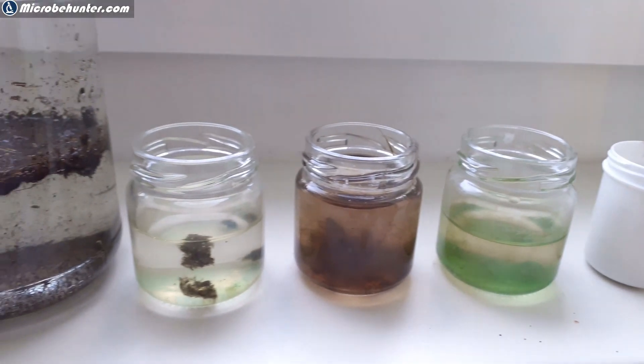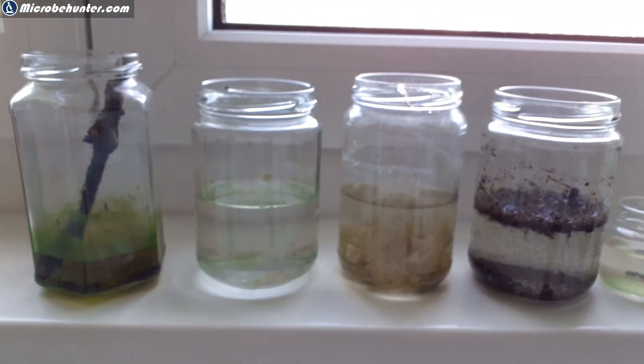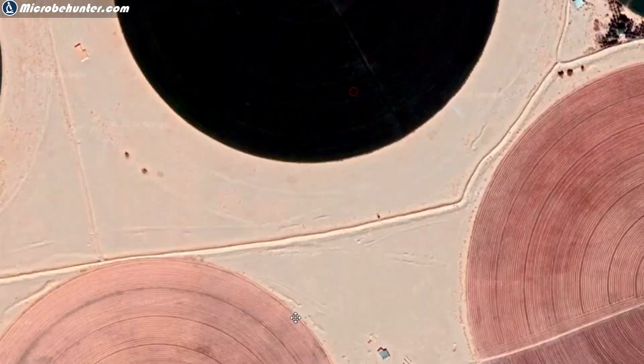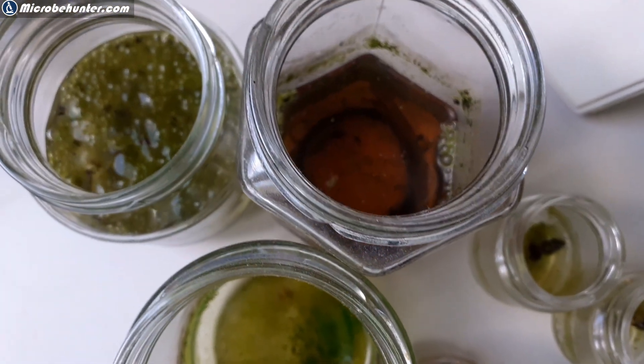Now I want to address the issue. If you do want to observe water samples, then yes, it is possible. What I would encourage you to do is a so-called enrichment culture. You take a glass jar, put water in it — don't use tap water, it could be chlorinated — use bottled drinking water. Add a little bit of artificial fertilizer, which you can buy in the shop. Then if you do find any standing water that has not been cleaned for some time, take a few drops and put it into the jar with fertilizer. Wait for a week or two, place it in a bright spot but no direct sunlight to prevent overheating. If you're lucky, some algae will grow after a few days to a week or two, and then you can put this under the microscope.